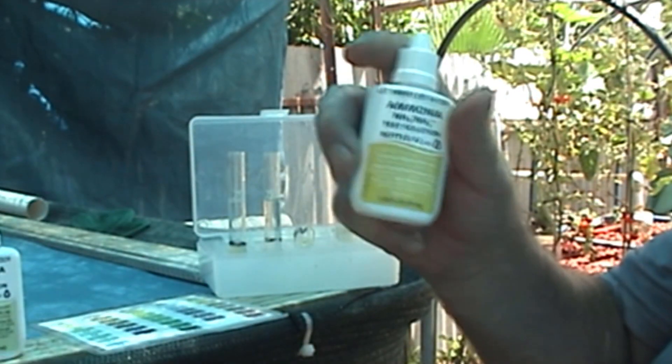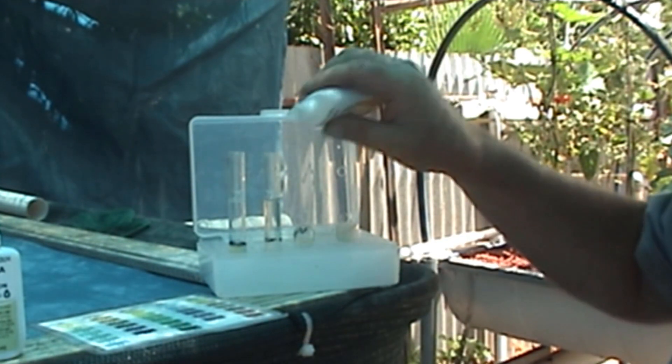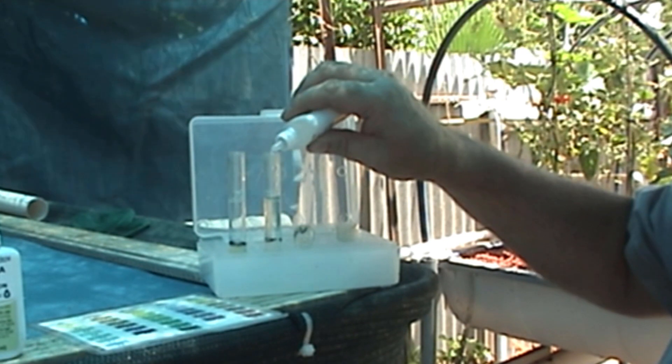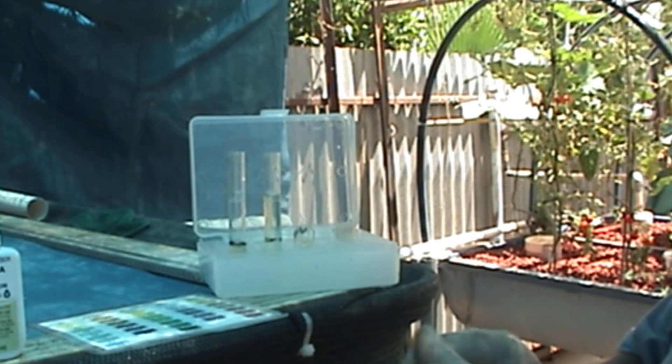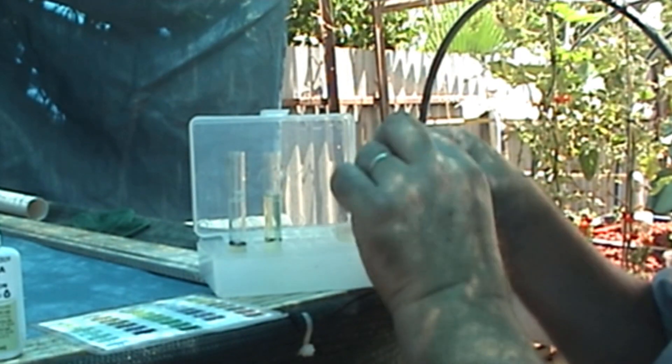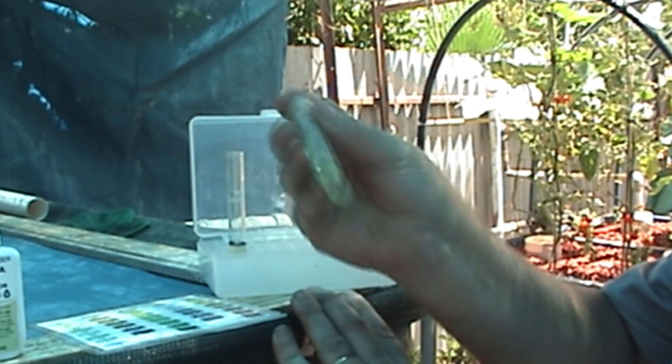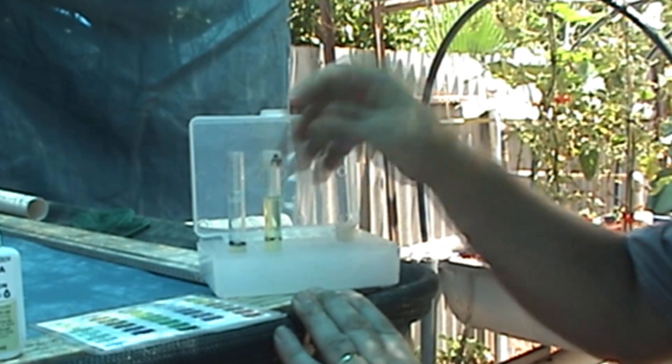And then part 2, it says 8 drops. 1, 2, 3, 4, 5, 6, 7, 8. So it's part 1 and part 2. Give it a little shake. Now it's got to set for 5 minutes.